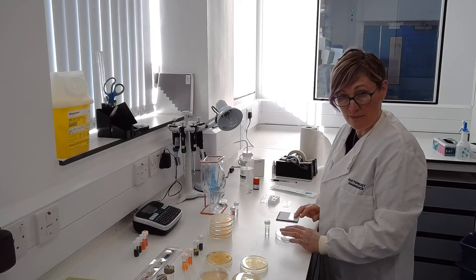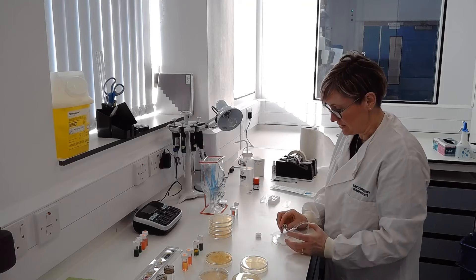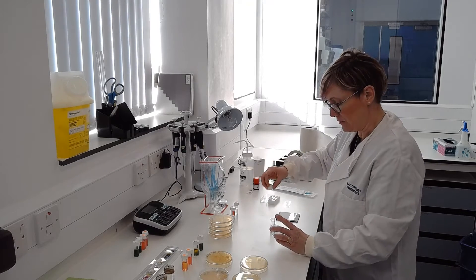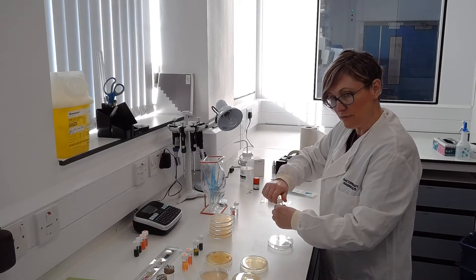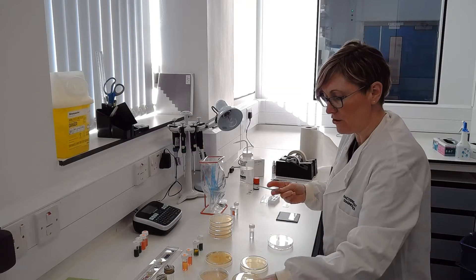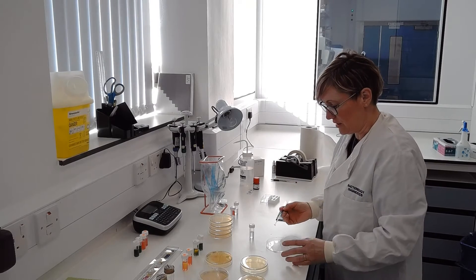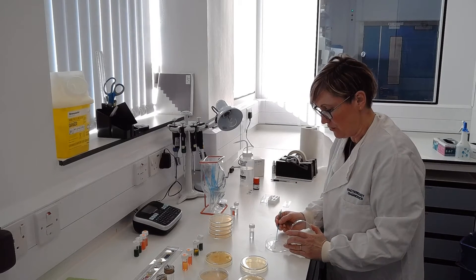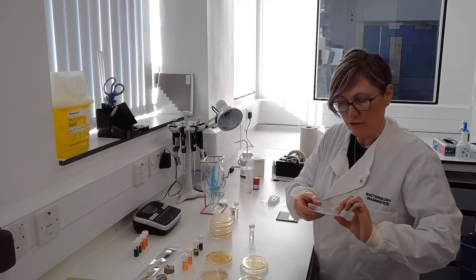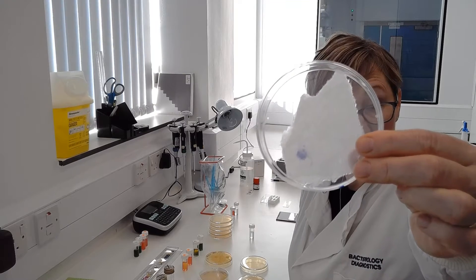Some of our tests work very quickly and we get an immediate result. I'm going to show you a couple of those just now — they're based on enzymes. The first one is an oxidase test, showing if the bacteria have oxidase enzyme. The substance poured on is colourless, but if the bacteria contains the enzyme, it will break off part of the molecule and produce colour. I take some of my bacteria from the agar plate and rub it onto the paper which is soaked in my substrate. Hopefully you can see very quickly there's a purple colour there, which indicates a positive oxidase result. That allows me to separate the bacteria out into different categories.